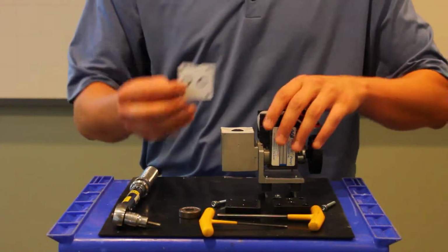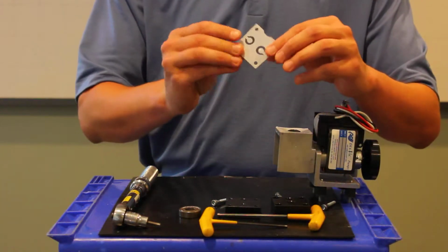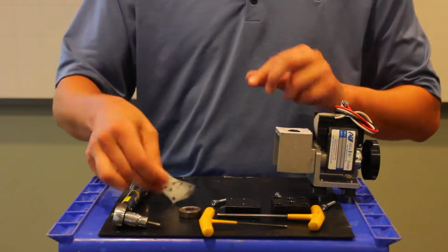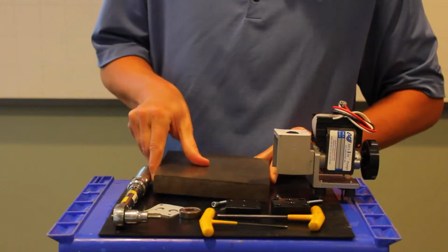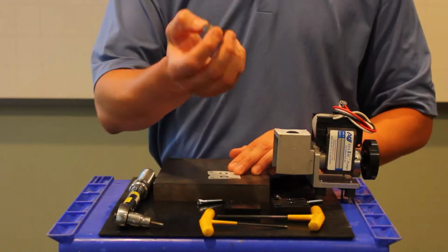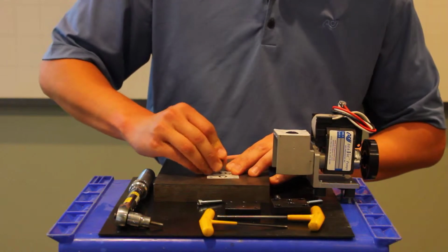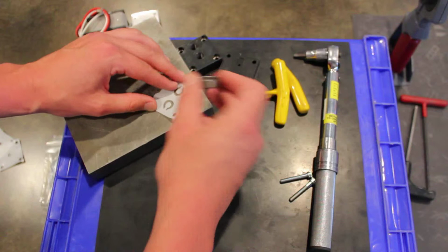Take our new gasket. And what I like to do, because sometimes in shipping it can get a little bit of a wave in the diaphragm, it's really important that these seals right here are really nice and flat relative to this round edge right here. So what I'll do is I'll grab a flat surface and place it down, and then I'll take the diaphragm and I'll put it down, and then I'll take the round object, such as a bearing, like I said, or an eccentric or a bushing, and I'll just rub away from me on the flapper valve, just to get a nice flat surface on them a couple times.